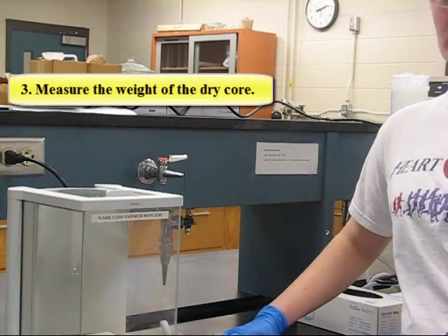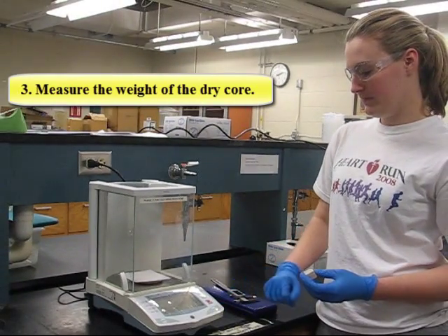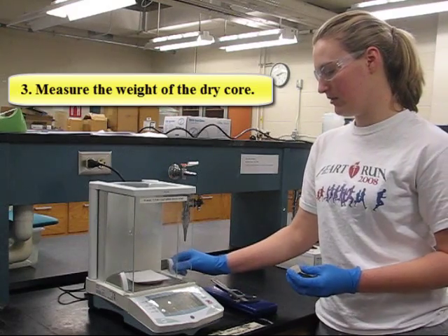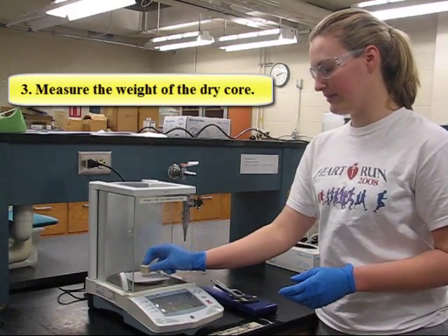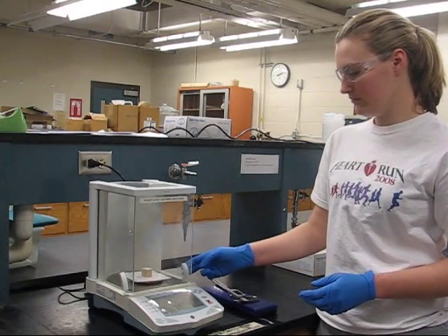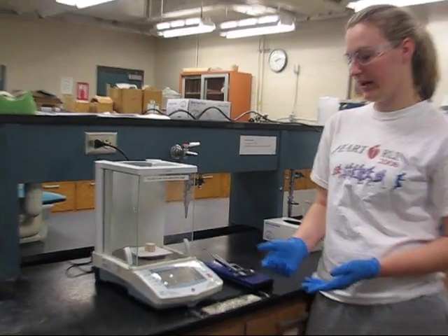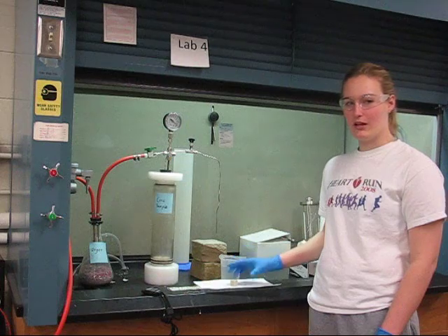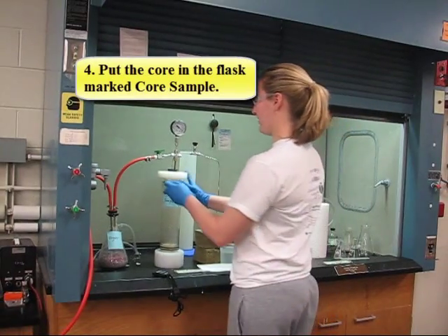We're going to make sure that our scale is zeroed out, open the sliding door, and gently place the core sample in there. Wait until the reading has stabilized, then record it. Then we're going to put the core in the flask that's marked for the sample.